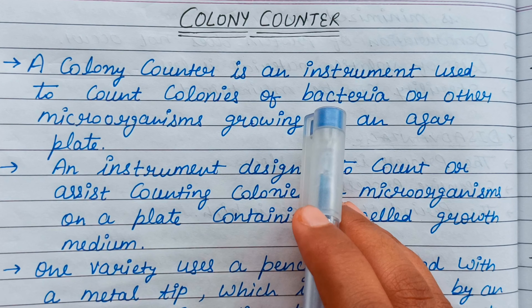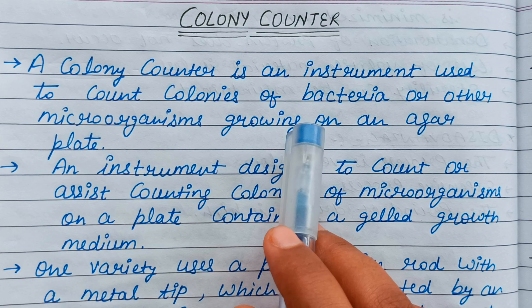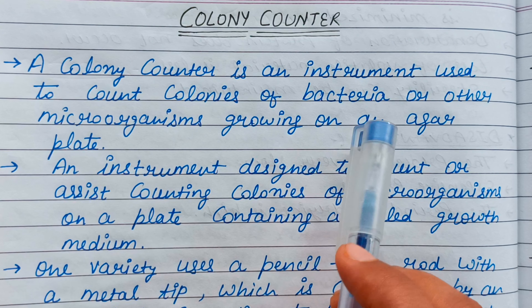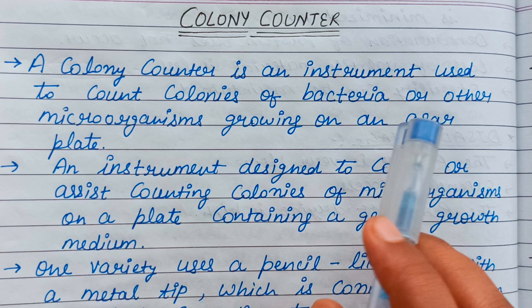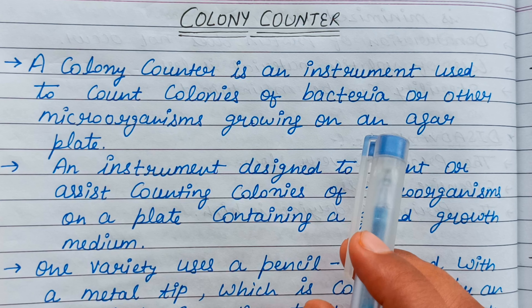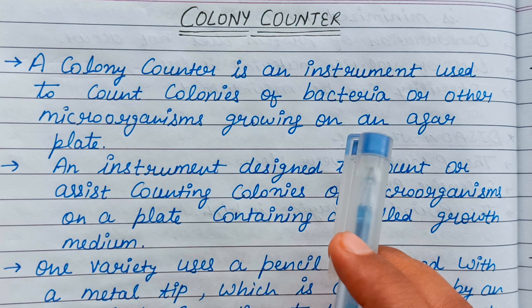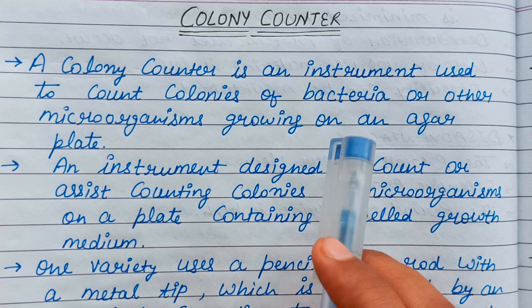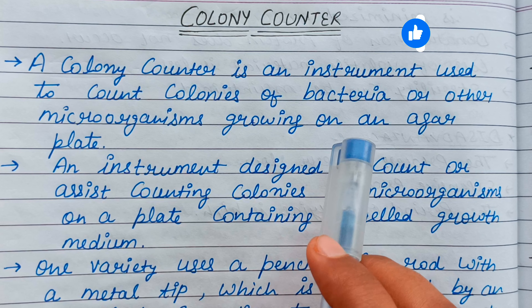Colony counter is very useful. If someone wants to count in the microbiology lab how many colonies are present, we can count it very easily using a colony counter.